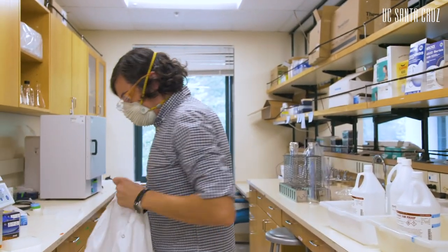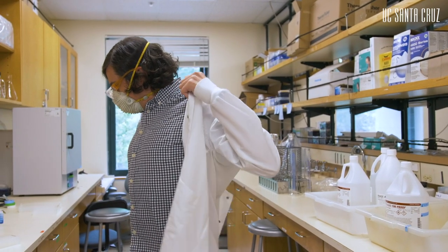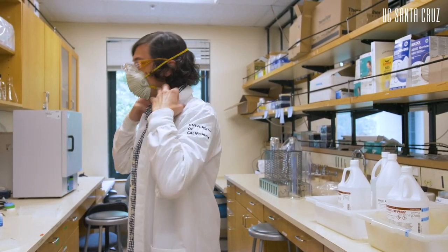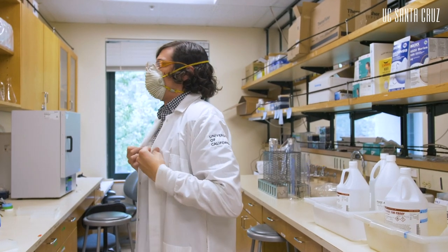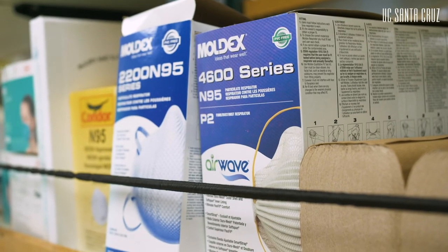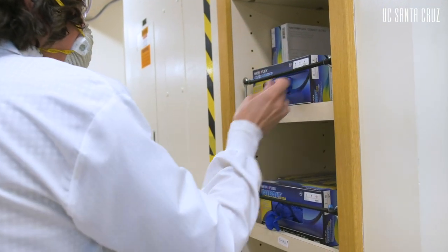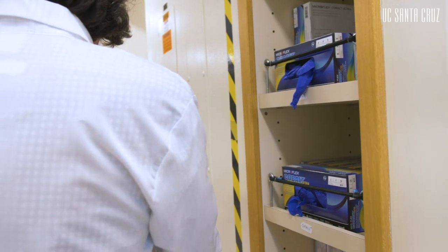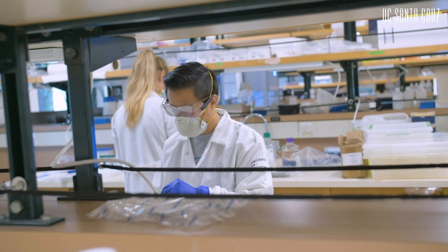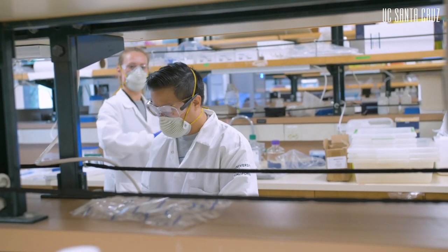Before entering the lab, all personnel must wear personal protective equipment, otherwise known as PPE, and must be trained on biosafety and protected health information. The PPE required includes N95 mask, lab coat, goggles, and gloves. This is to protect the lab staff and to ensure that there is no contamination in the lab. Any small amount of DNA from personnel can compromise results and change effectiveness of the testing.